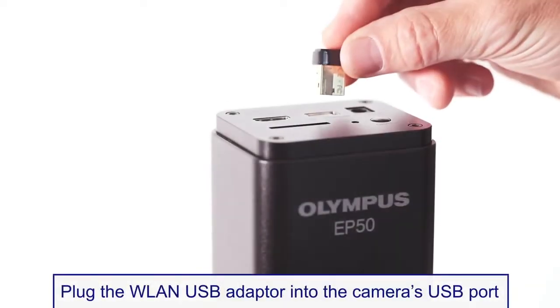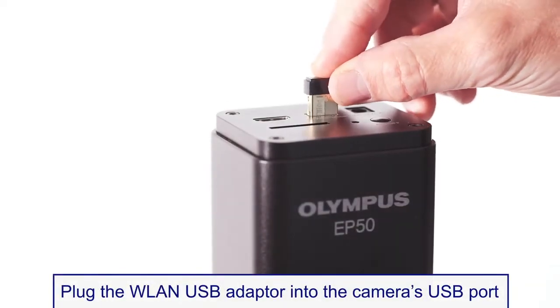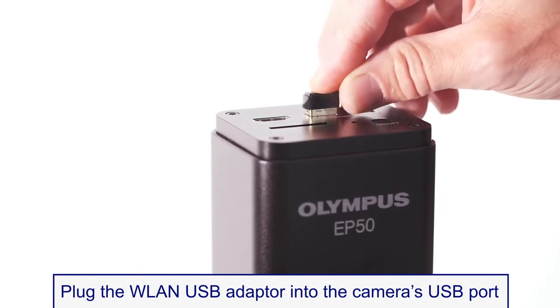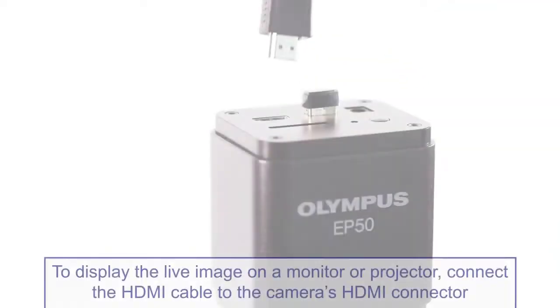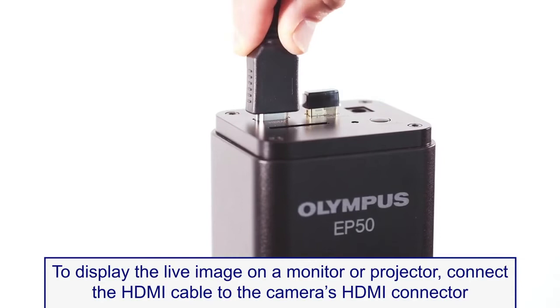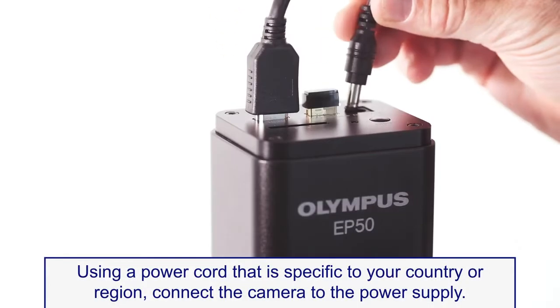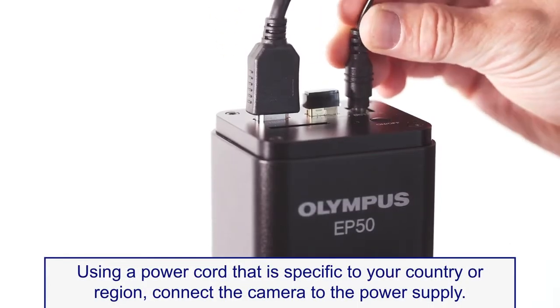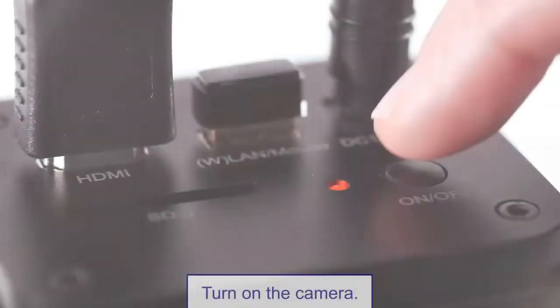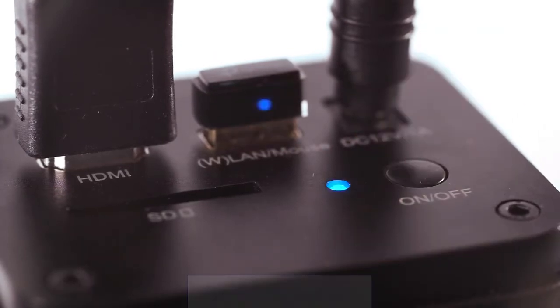Now plug the USB WLAN adapter into the camera's USB port. If you also want to display the live image on a monitor or projector, connect the HDMI cable. Then plug in the power supply cord and turn on the Olympus EP50 camera.